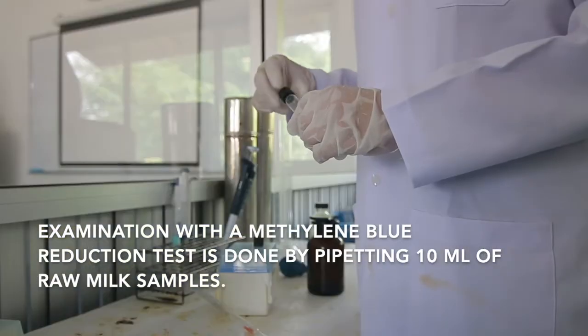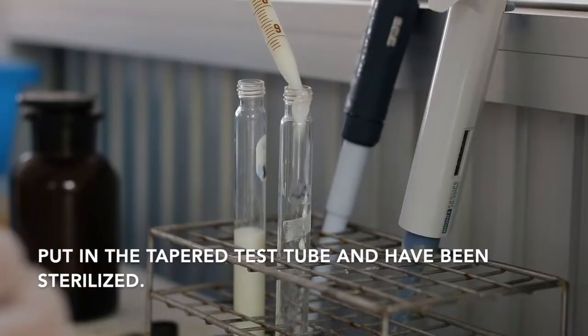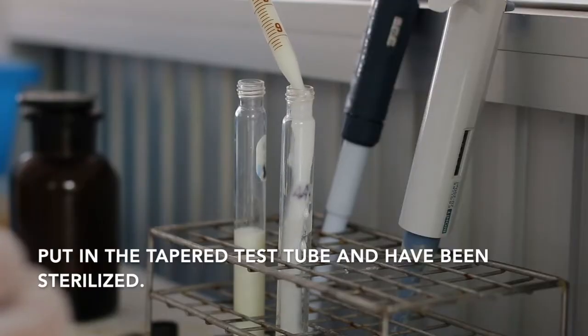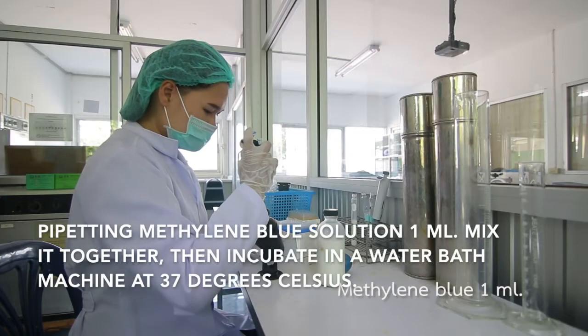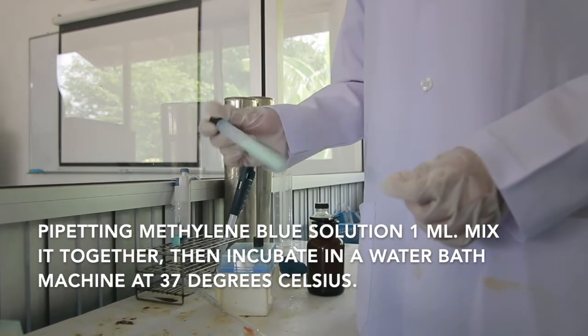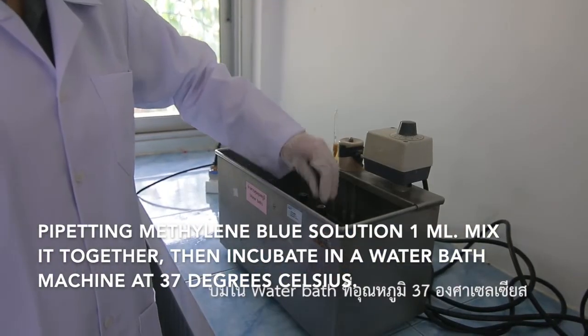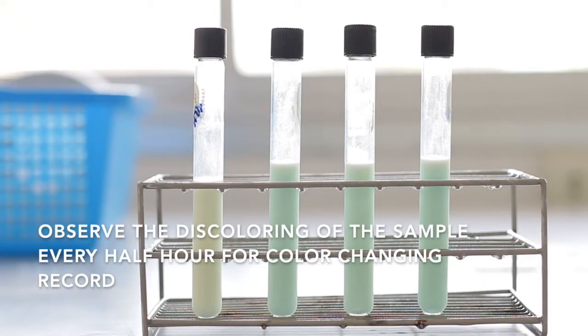Examination with the methylene blue reduction test is done by pipetting 10 ml of raw milk sample, putting it in a sterilized test tube. Pipette methylene blue solution 1 ml, mix it together, then incubate in a water bath machine at 37 degrees Celsius. Observe the discoloring of the sample every half hour and record the color change.